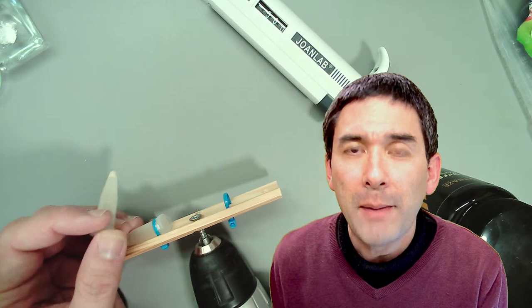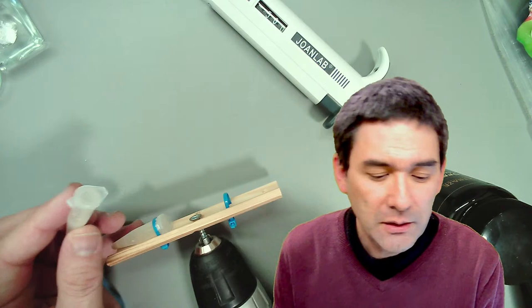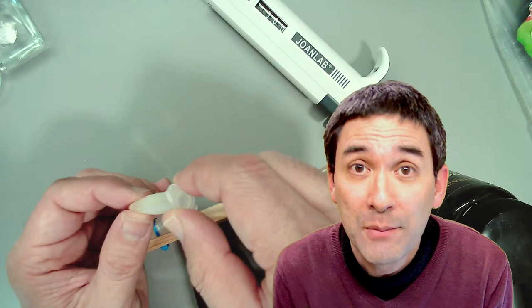I simply wanted to catch up on that demonstration since I promised it. Regarding the tubes — these are called Eppendorf tubes, very commonly used in molecular biology, for example in DNA extraction. They're disposable plastic tubes available in large quantities on Amazon. Glass test tubes are too large and require cleaning, so Eppendorf tubes are quite nice for collecting microscopic specimens.